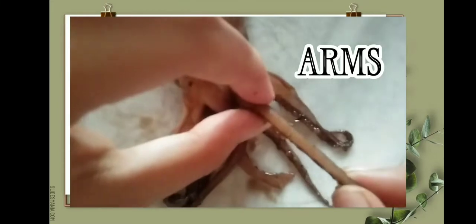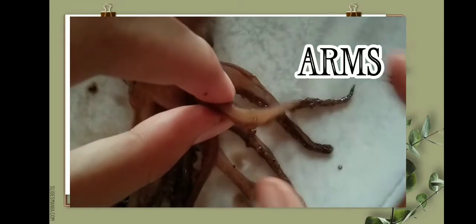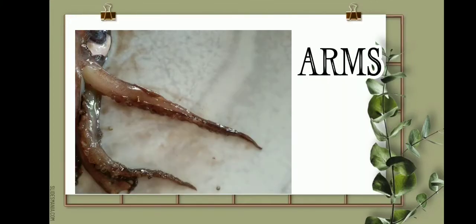Next are their arms. Squid have 8 arms, which they use to hold onto prey when captured. They also use their arms to bring the food to their mouths. They also use their arms to break or cut food before intake.